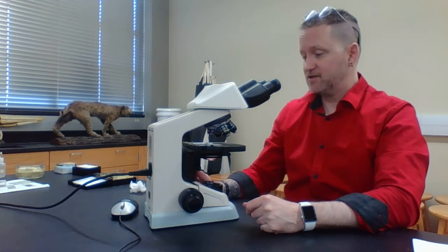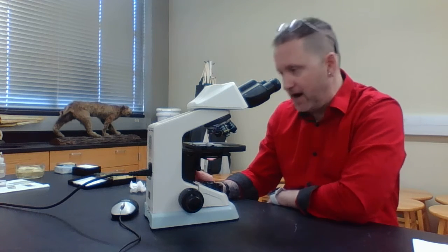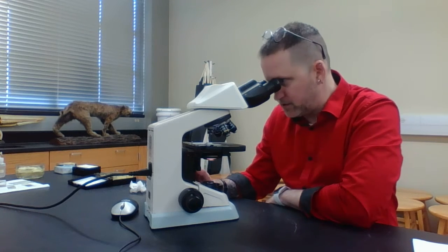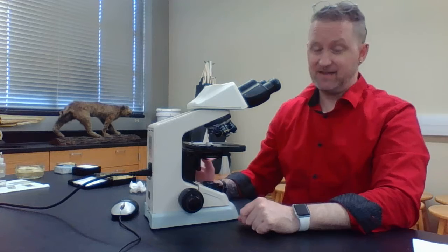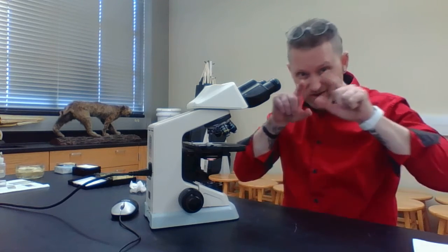And notice, there are 2 questions I have for you. If I say move the microscope stage to the left, your letter E is actually going to move to the right. If I say move it to the right, the letter E is going to move to the left. So everything's flip-flopped. These mechanical stages actually work well. If you don't have a mechanical stage and you have to use your fingers, you have to be aware of what you're looking at.